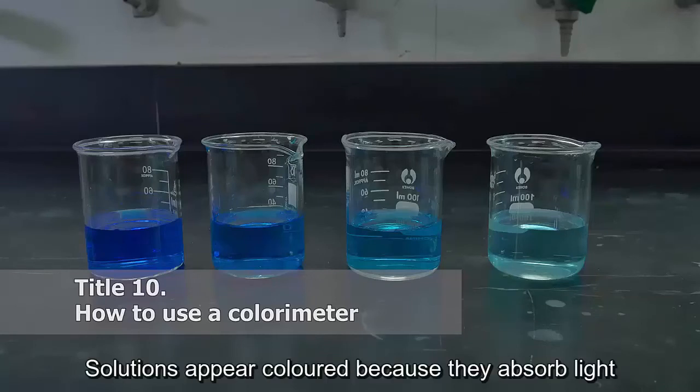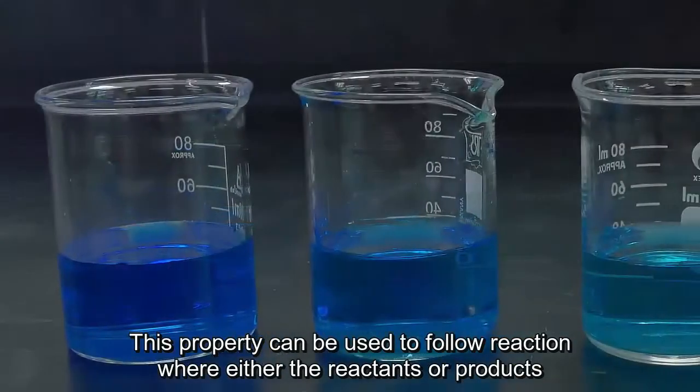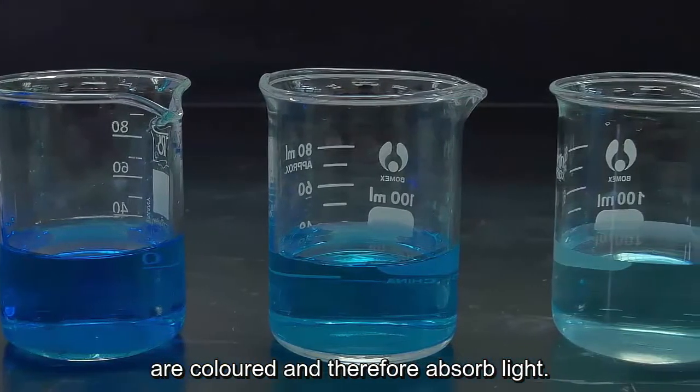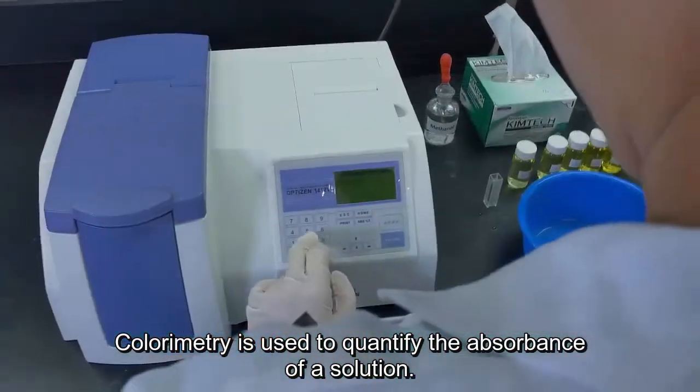Solutions appear colored because they absorb light at particular wavelengths in the visible spectrum. This property can be used to follow reactions where either the reactants or products are colored and therefore absorb light. Colorimetry is used to quantify the absorbance of a solution.